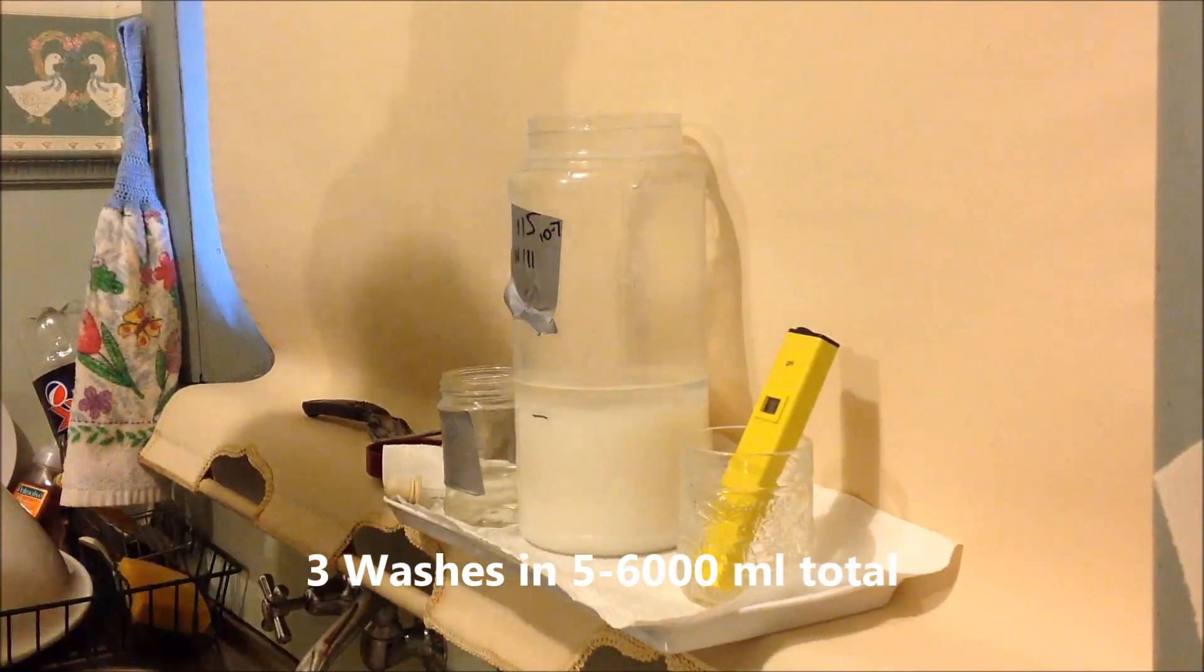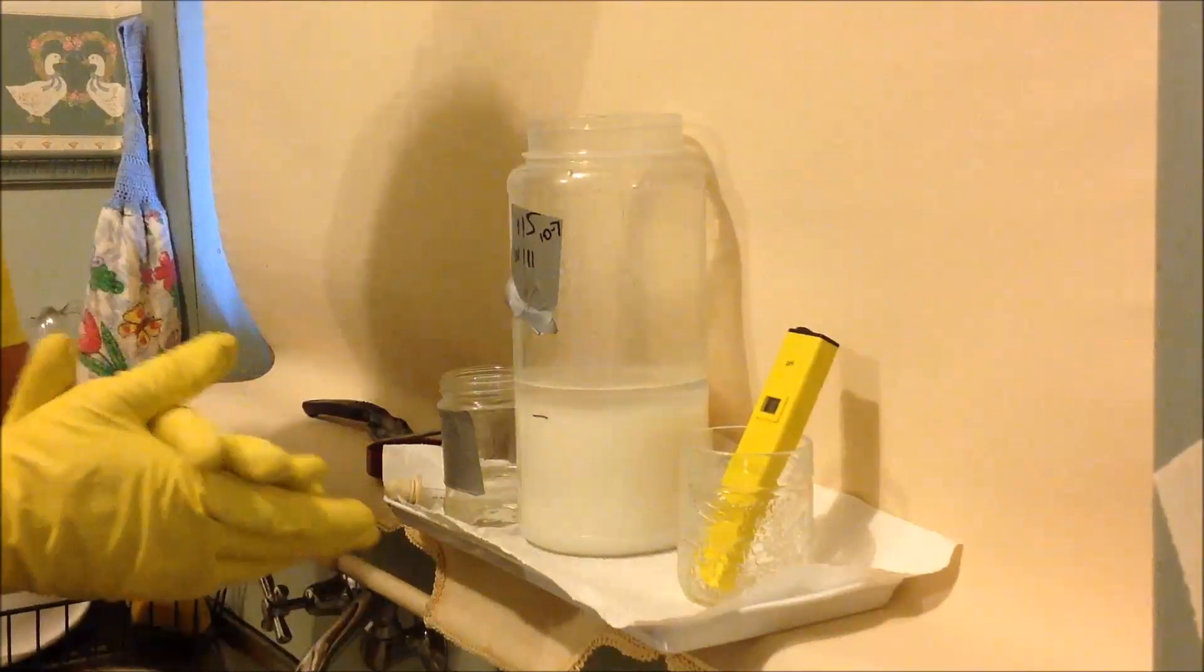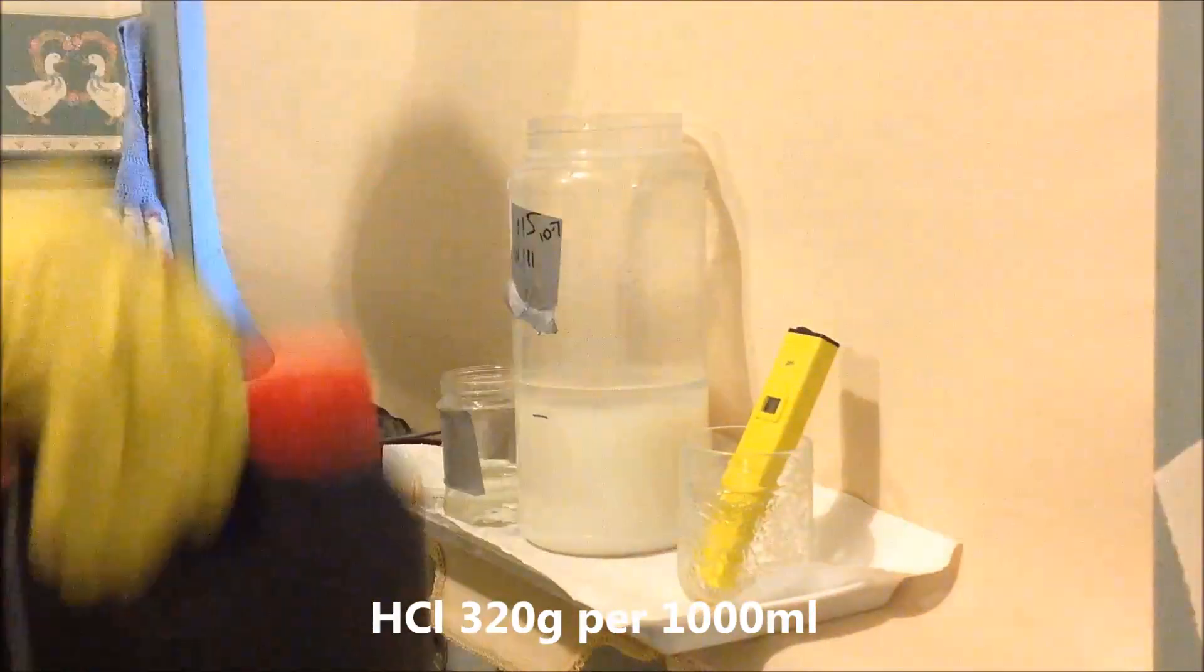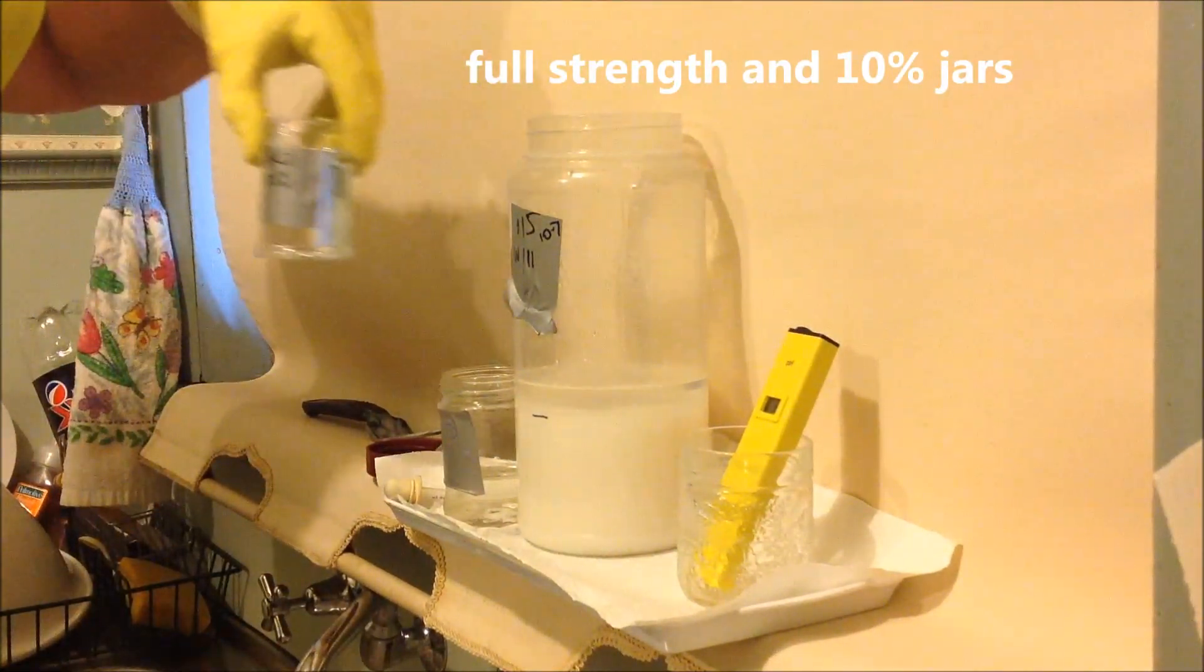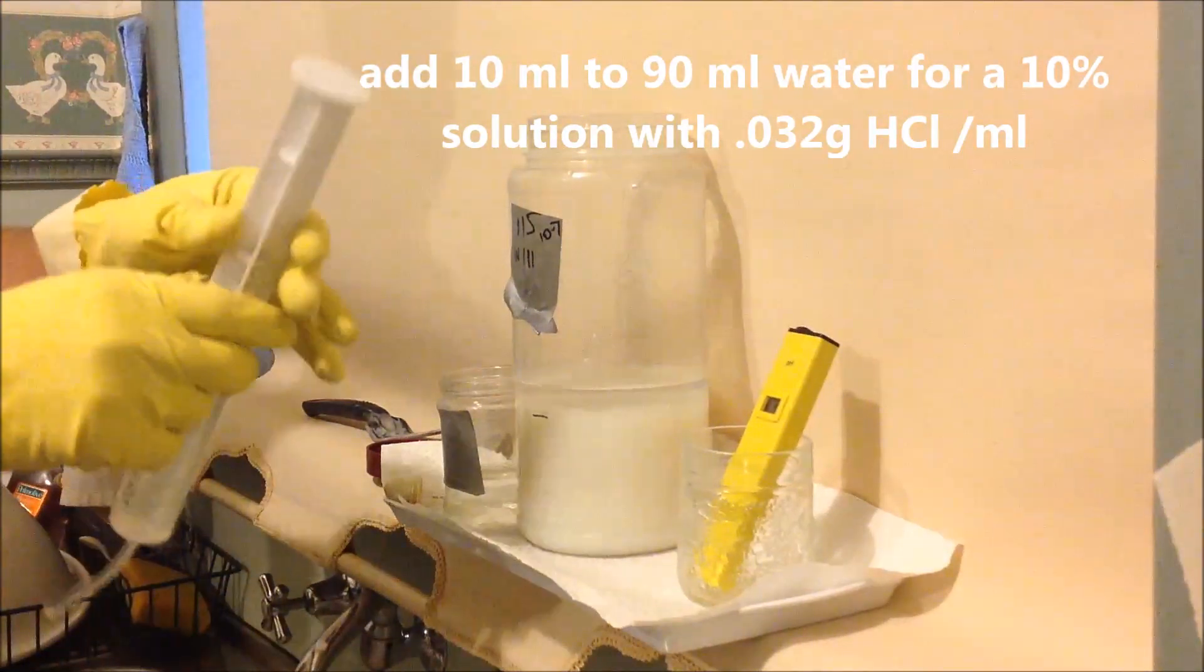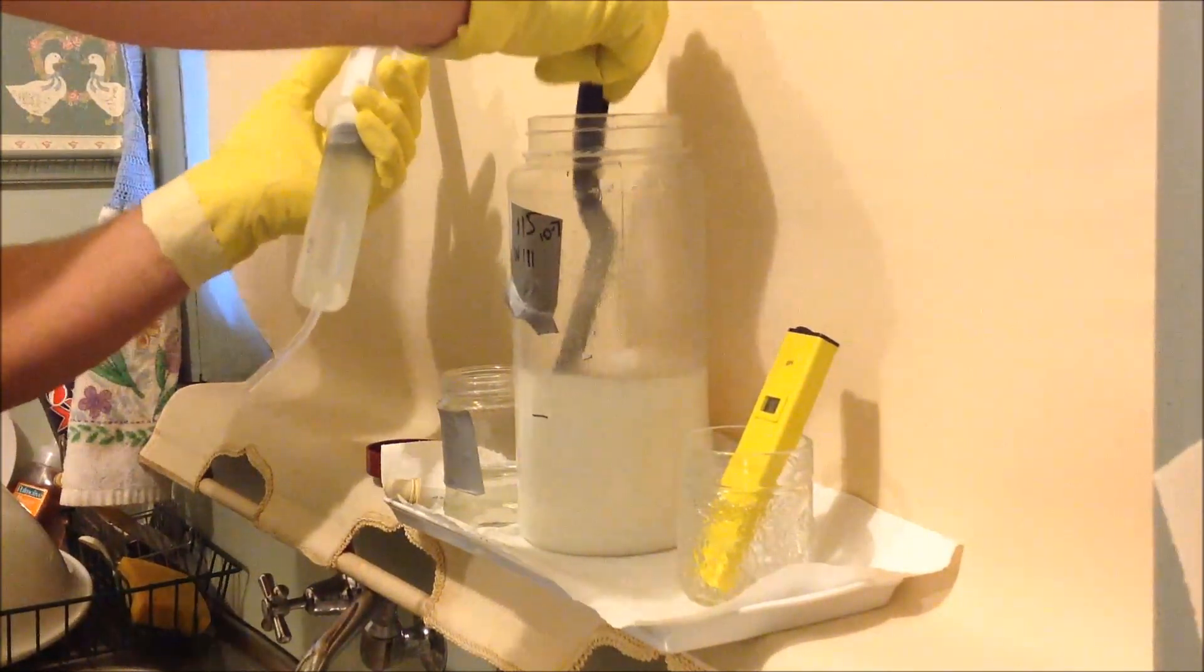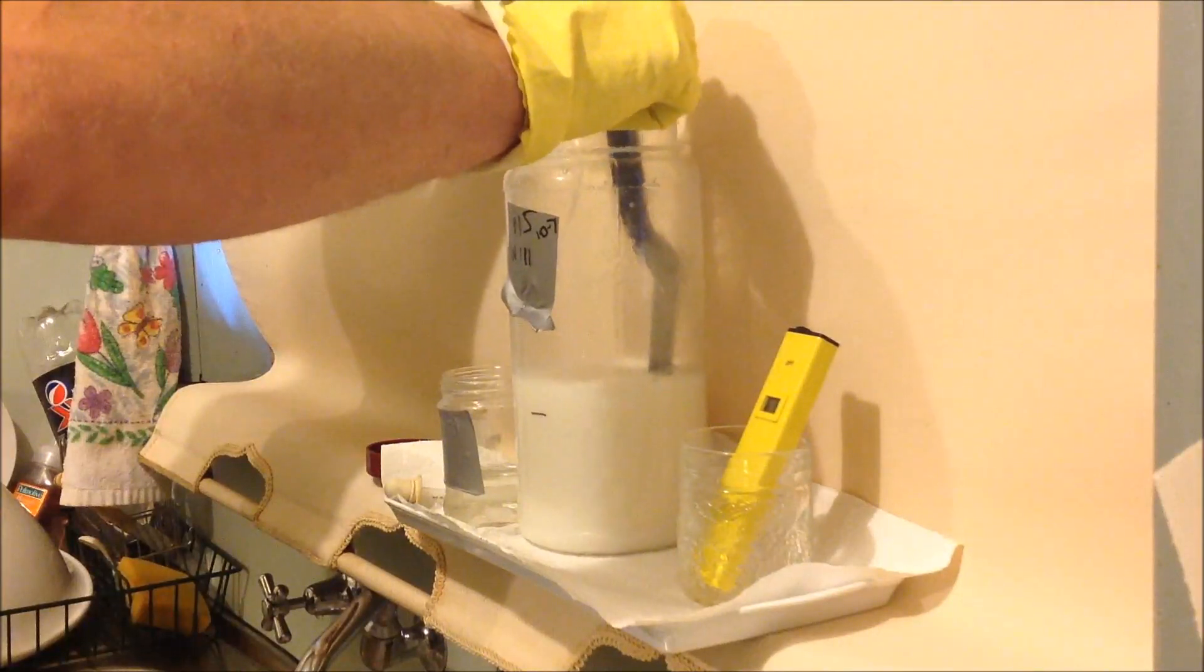It's been washed three times. You can see from the mark there that we haven't lost any precipitate. And so now at this stage, we're going to add hydrochloric acid and take the pH. It was originally 10.7 and we're going to take it all the way down to near 1. Well, our goal would be to clear all of that. We're using hydrochloric acid. This is already 30% made up. And we'll put it into handy little containers. And one of them reduce it down to 10% for the fine adjustment at the end. You'll find the reaction will go very quickly towards the end. My trusty stirrer. See that? Look, it really is like a fine yogurt. You can feel the stiffness of it. Maybe a cream. And I'll get myself organized here.